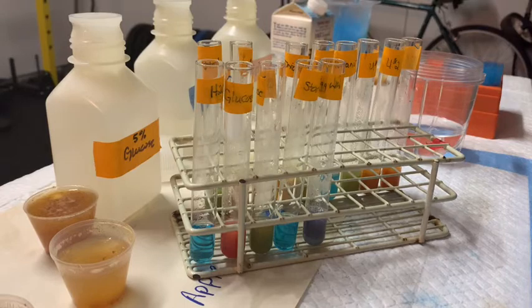That's the Benedict's test. I'm going to clean up, and then we're going to do a test for triglycerides, fats, and oils — and it's going to be a little bit different.